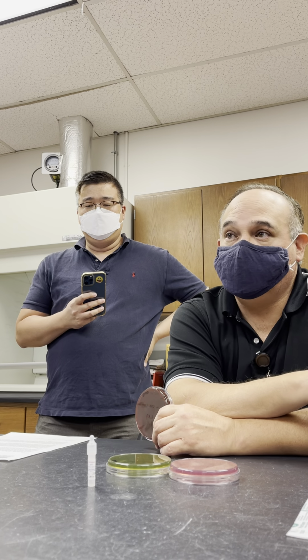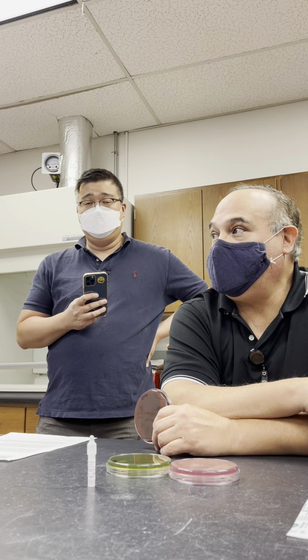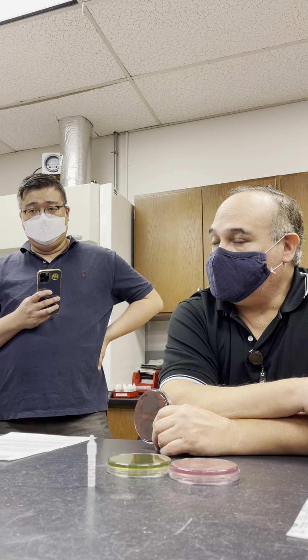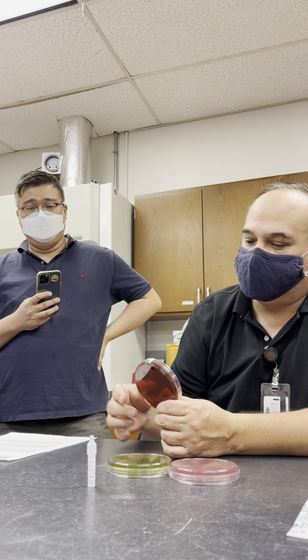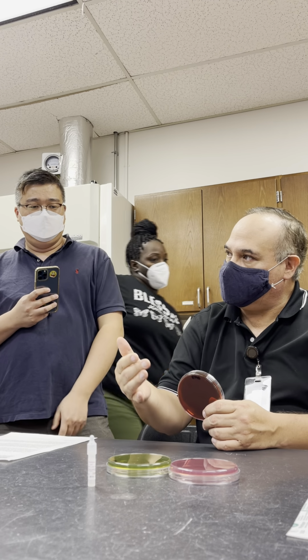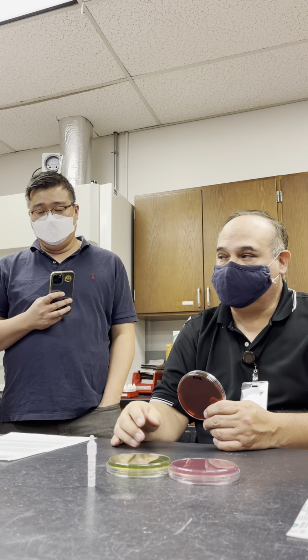So glucose is not a good tool because they all do it, right? So we go to lactose. Lactose, half of them ferment it and half of them do not. It's a great tool to differentiate them, okay? The other thing is oxidase, and we'll talk about it in a minute. But this medium has got eosin, methylene blue and bile salts.